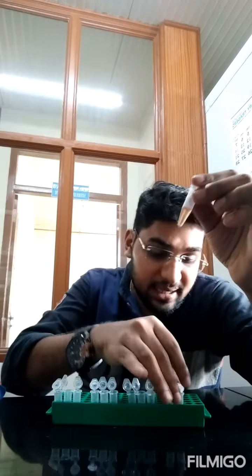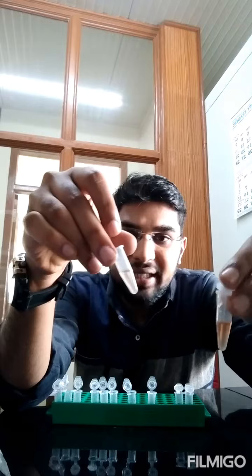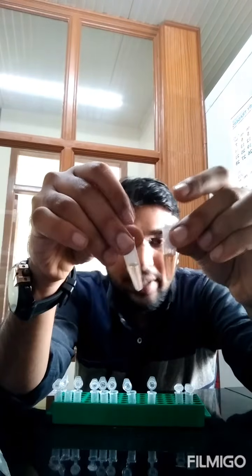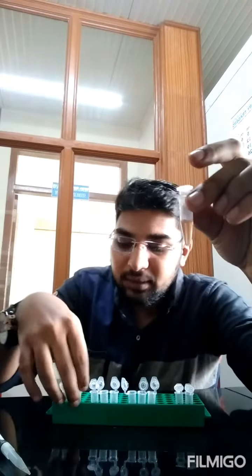So friends, if you see, the seed has got a nice orange color, which indicates the seed has proline content. You can see the beautiful orange color. But when you compare this with the leaf, it is very less. This is the leaf, but still a slight tinge of orange is there. That indicates proline is present, but not in very high quantity. Comparing seed and leaf, the leaf quantity is very much less. The stem has even less, but you can still find a very slight tinge of orange. And the root doesn't have any amino acid; it is a bit transparent. So out of root, stem, leaves and seed, from seeing the color, we can come to know that the seed has the highest amino acid content, with respect to proline content.